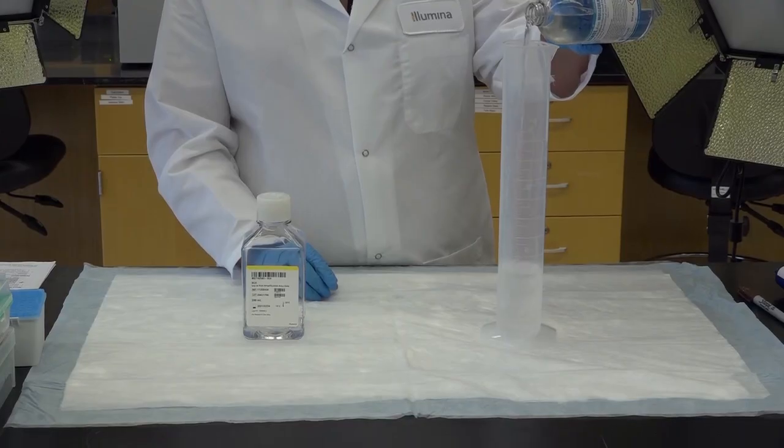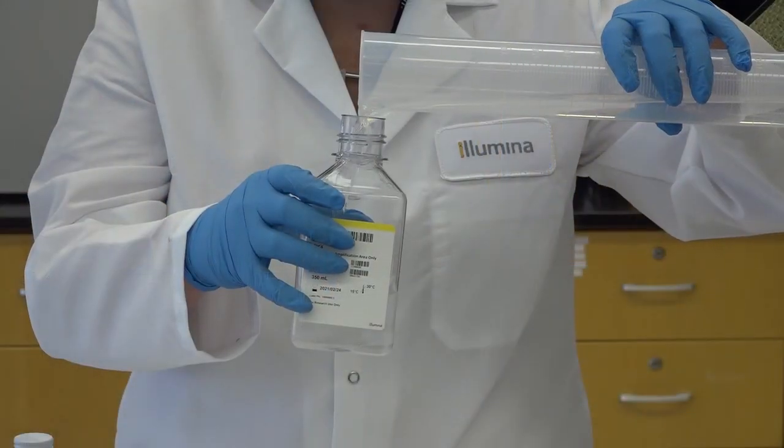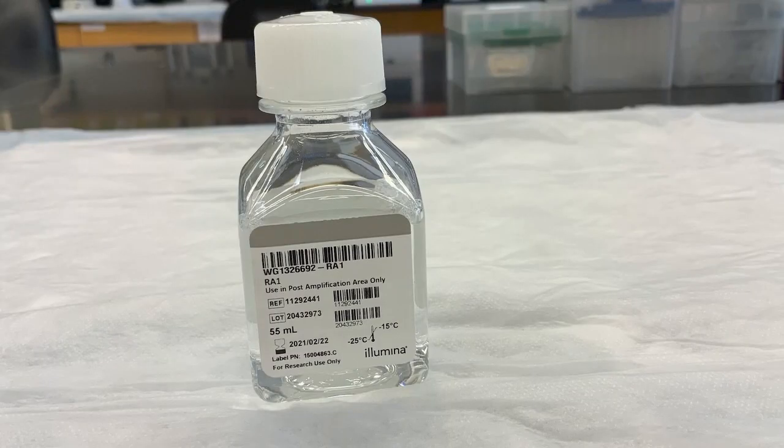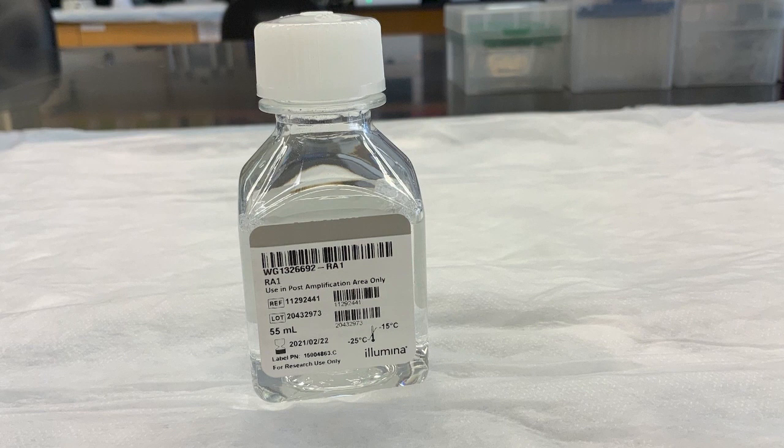Following the hybridization procedure, resuspend the wash and coating reagent for use the following day. Store remaining resuspension reagent at minus 20 degrees Celsius. It will be used in subsequent protocol steps.